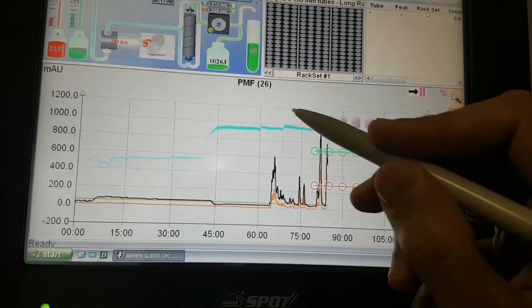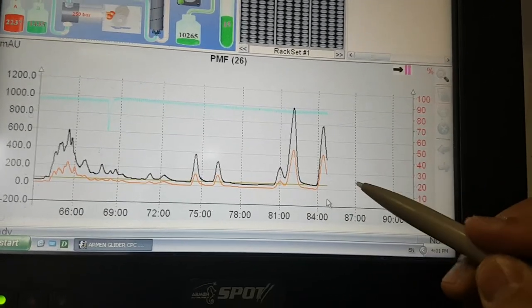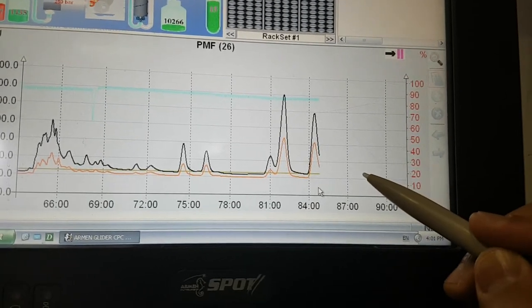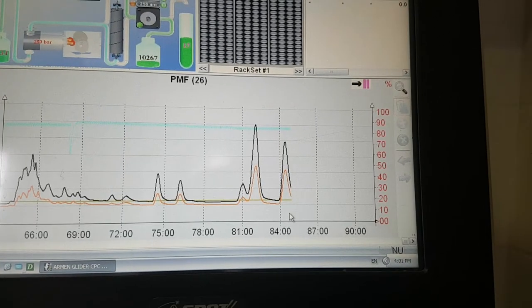I think this one is the last one. Now we can inject, for example, here the next until finishing our amount.